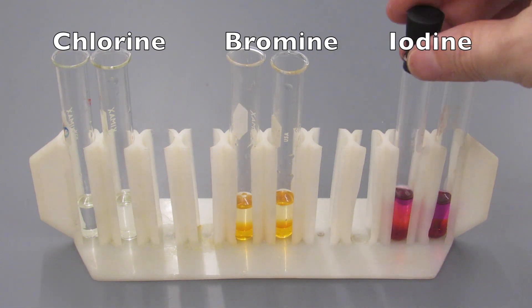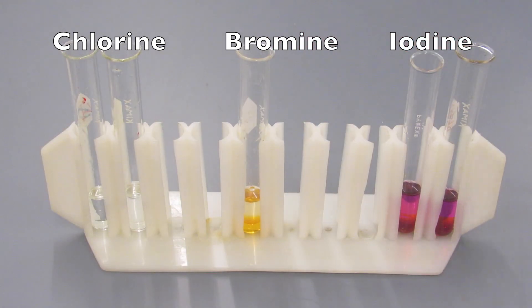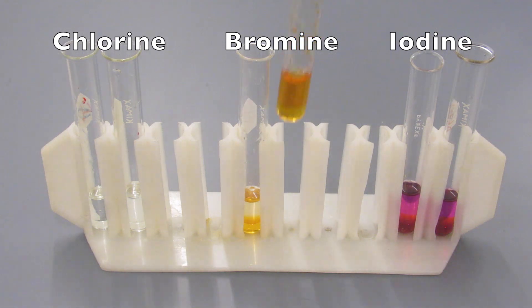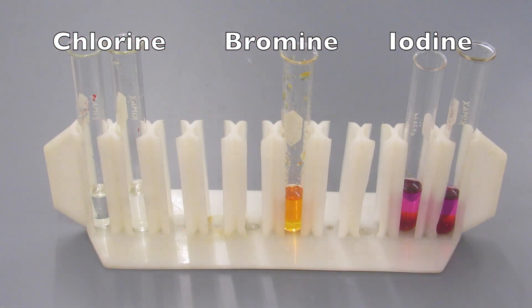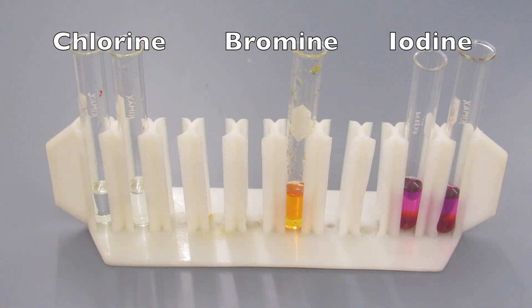We do this so that when we add the corresponding sodium salts to see if these things react, we can look at the top layer and see what element is in that top layer. That'll tell us if a reaction occurred or if a reaction did not occur.